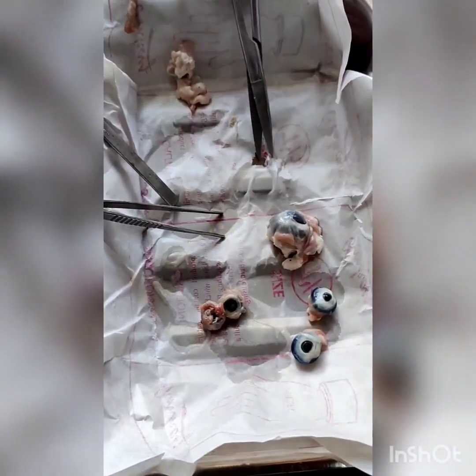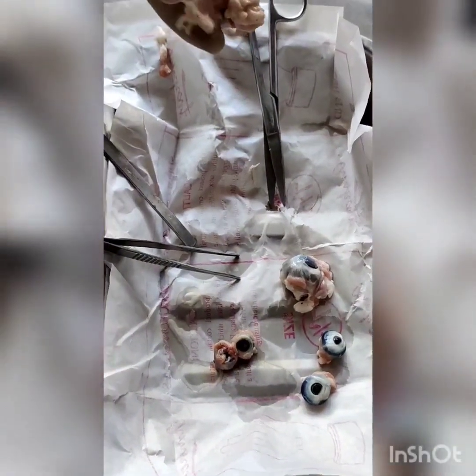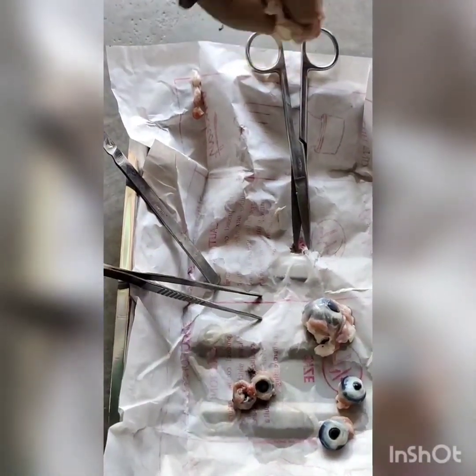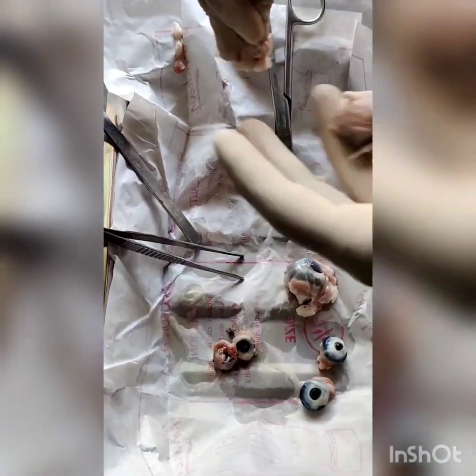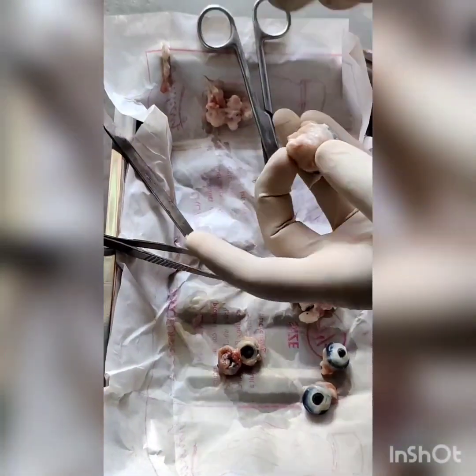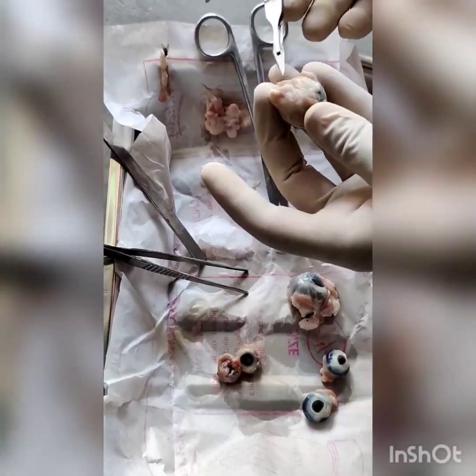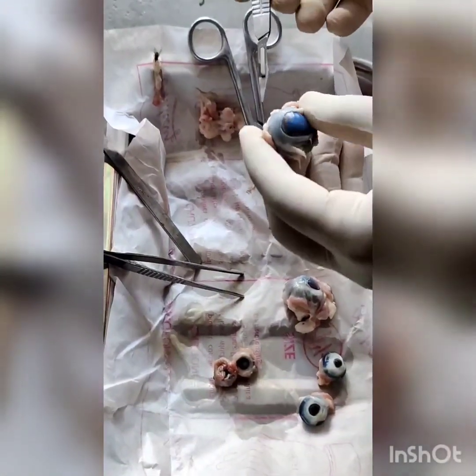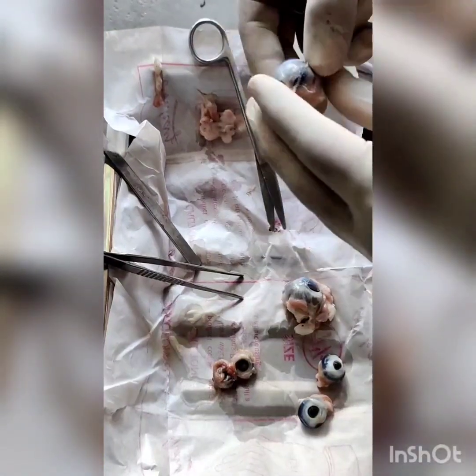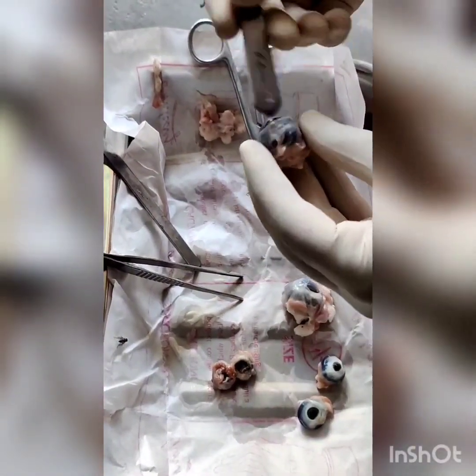I have cut it down. All the muscles are visible — there are seven muscles: four recti, two oblique, and one retractor muscle. The retractor muscle arises from the orbit part behind the optic nerve, and the retractor muscle covers all of the eye.